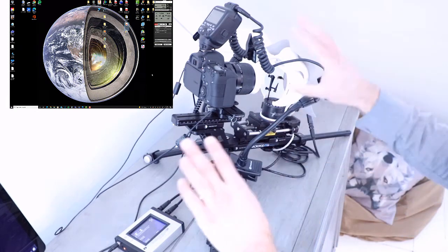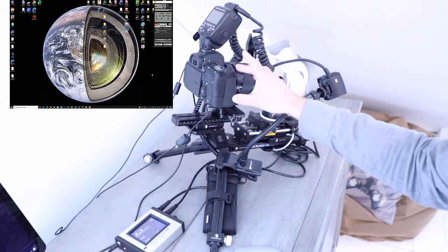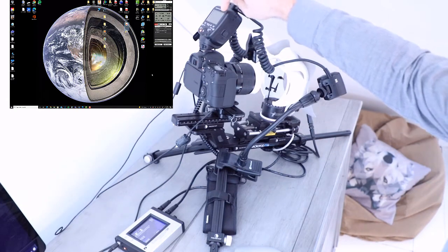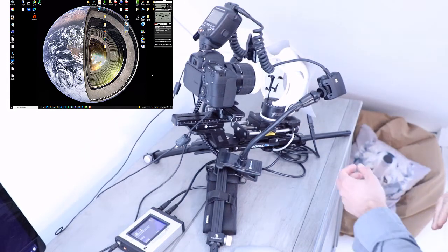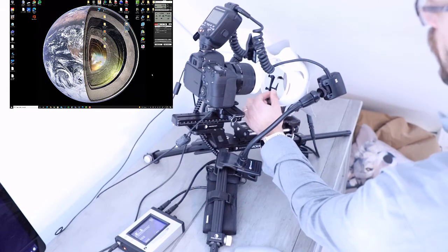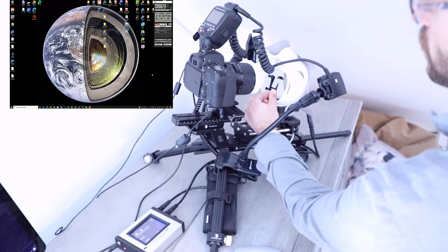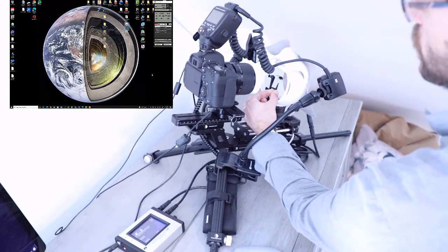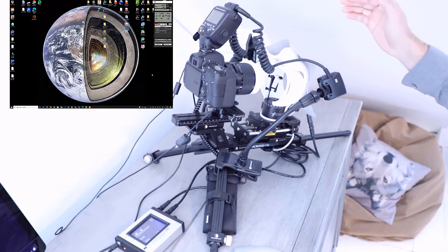So because the system is still set up from when you're capturing images, all you need to do is just half press, not full press, but half press the shutter. That will turn the sleep mode off on the flash and get that active and charged again. The next thing you're going to want to do is, without moving the stage, rotate your specimen. So I'm going to turn the B here. There we go. Just 180 degrees. That way now when the rotational stage is rotating, it's capturing the other side.